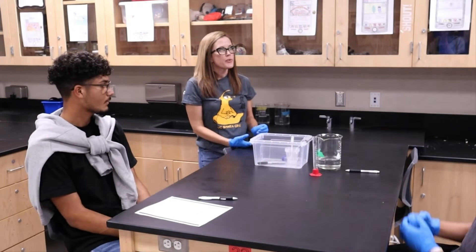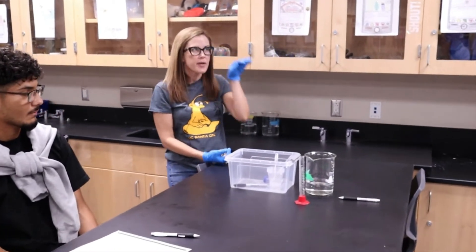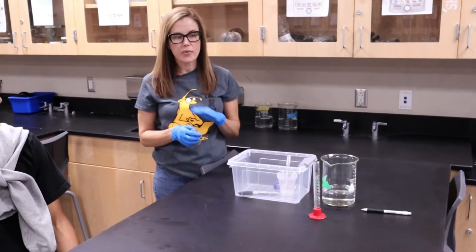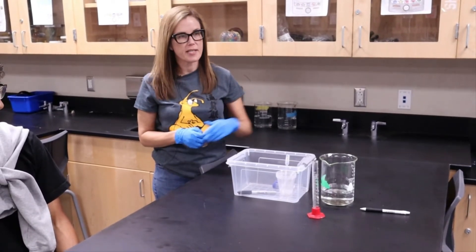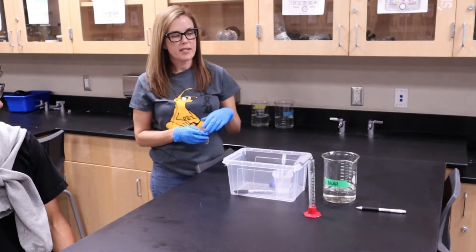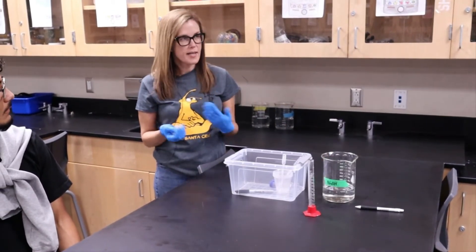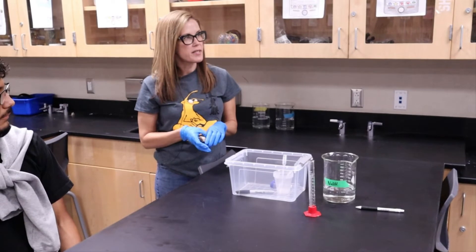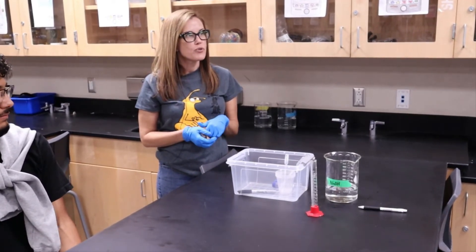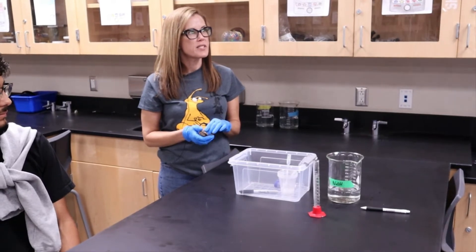That's what we expected, because enteric coatings are supposed to dissolve in the small intestine. In part two of the experiment, now that we understand more about how enteric-coated pills are created and how they work in the digestive system, you're going to focus only on the small intestine. Sodium hydroxide is representing the small intestine because it's basic — that's the pH of the small intestine.